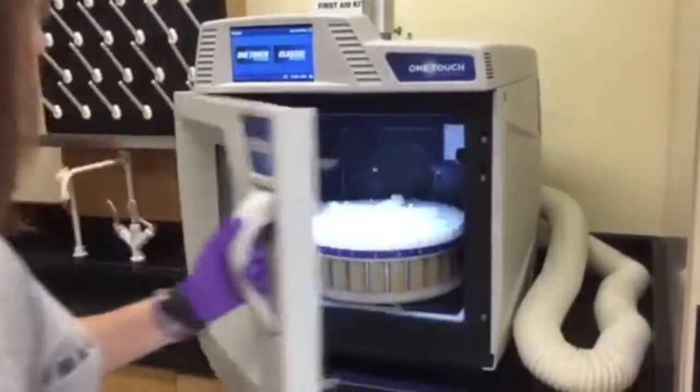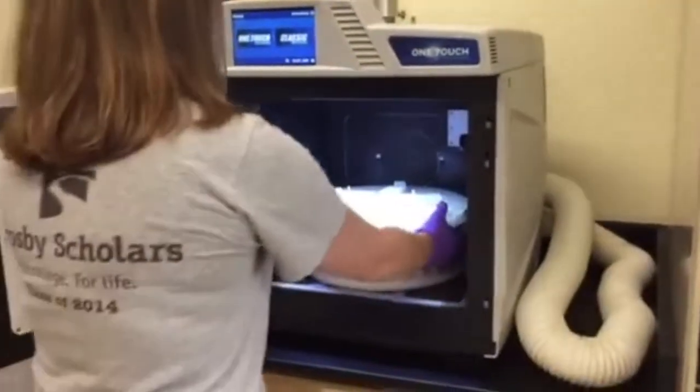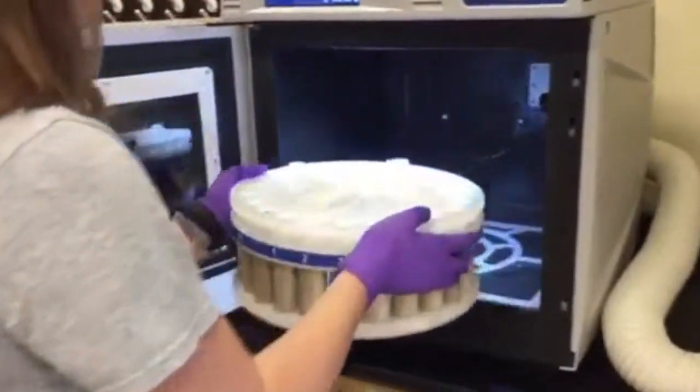Inside the microwave, you will find a turntable with 25 vessels in which the reactants and a control will be placed.